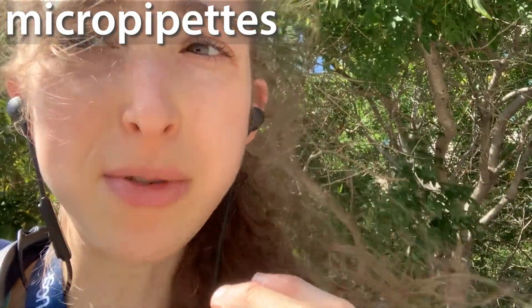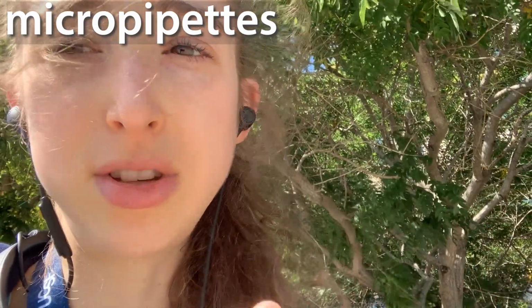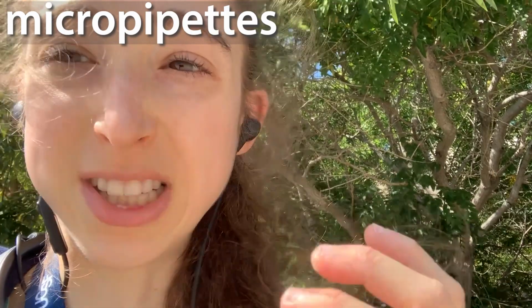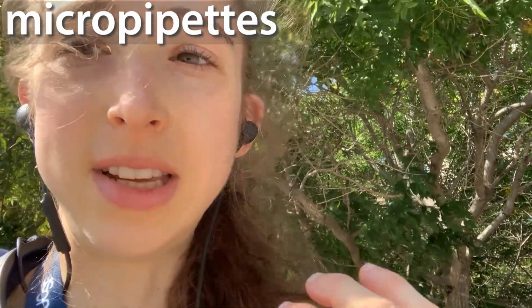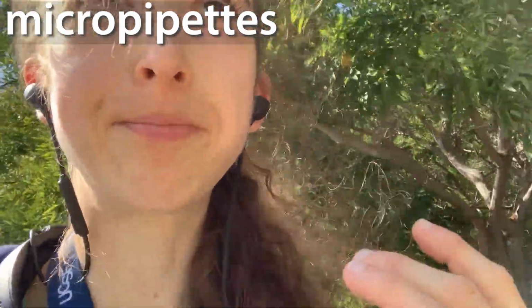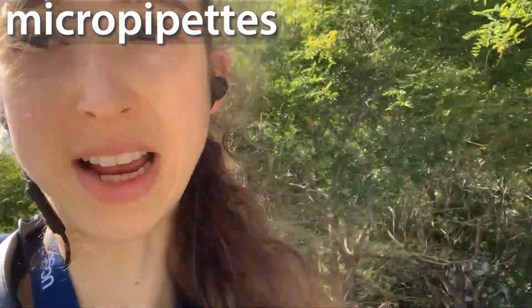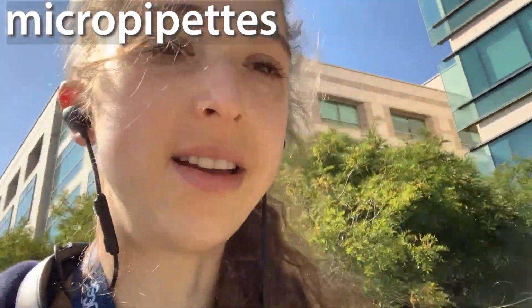If you need a larger volume but you need it to be more precise, you can always do it twice with a smaller size pipette, that sort of thing. Of course, then you have to worry about losing liquid, because every time you transfer something, you have the potential to be losing liquid on the sides of the pipette.